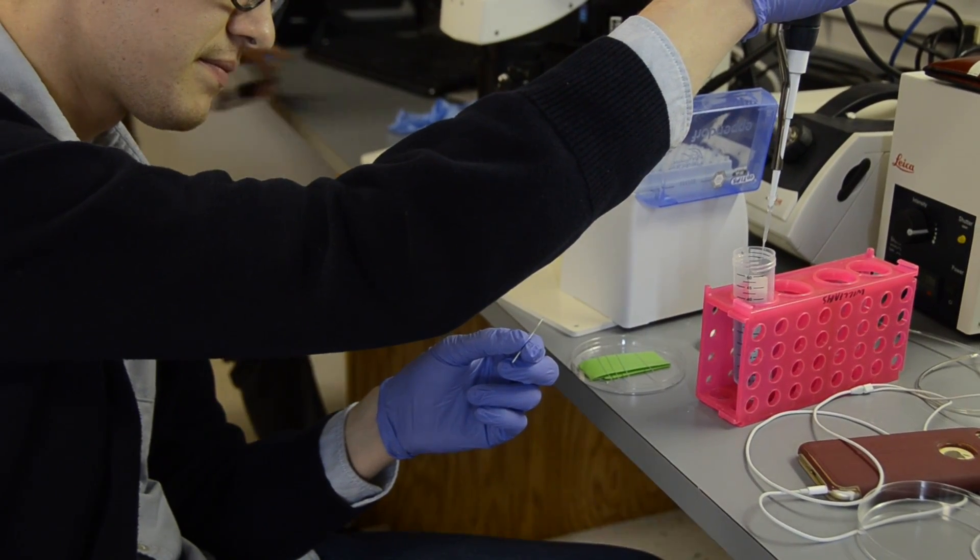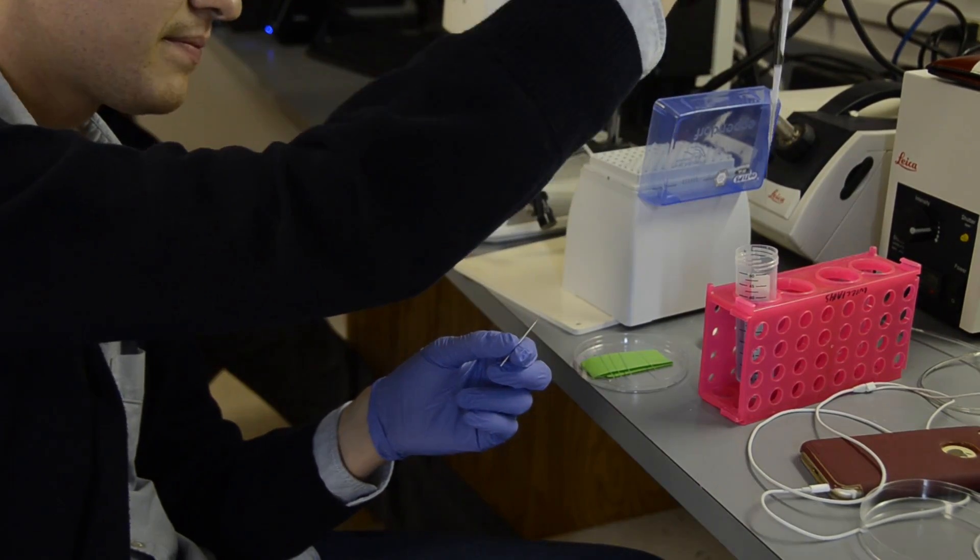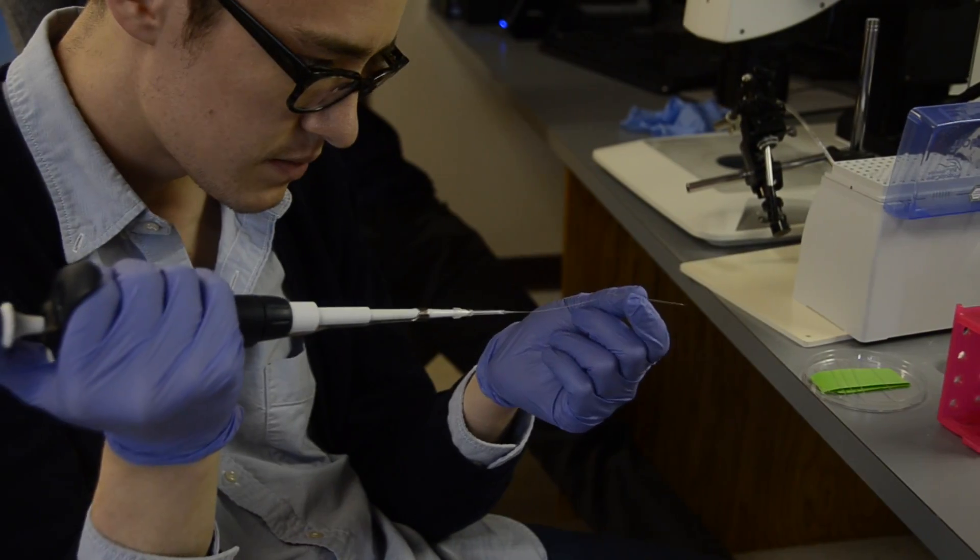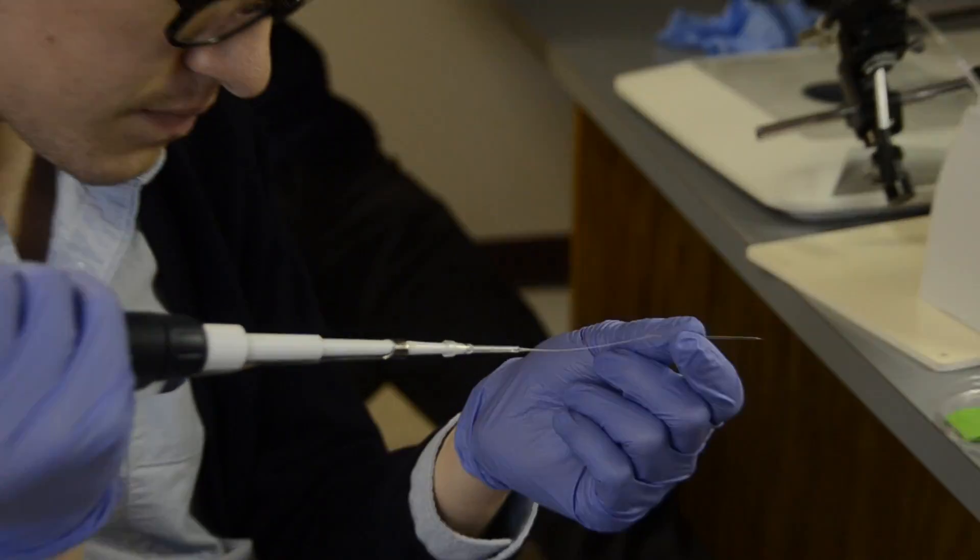Before microinjecting, familiarize yourself with the microinjector. Know how to move and operate all the components. This will make it much easier to maneuver and inject during a procedure.